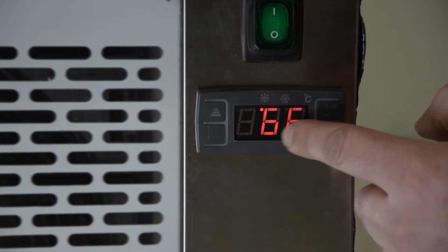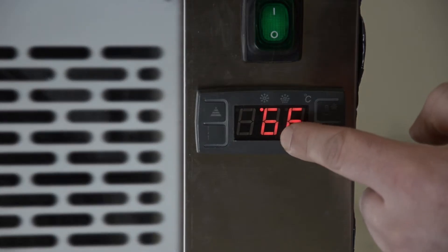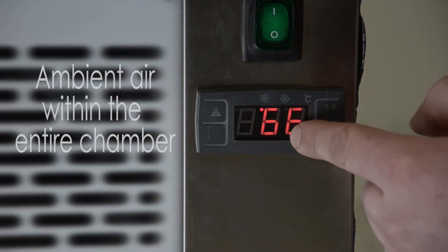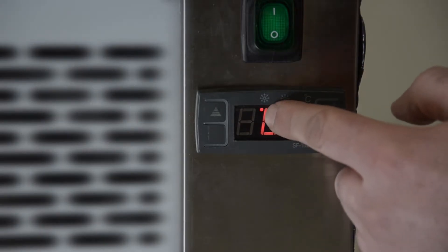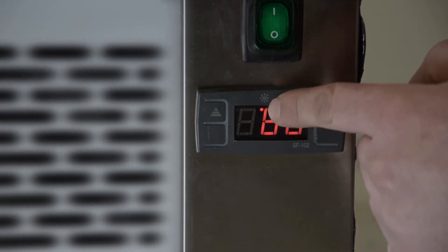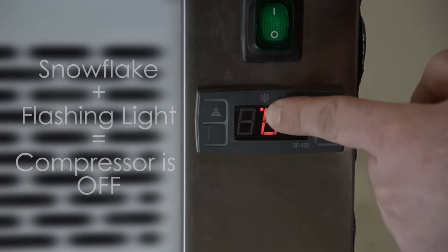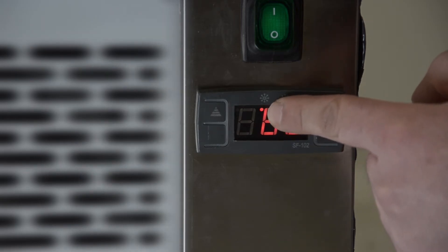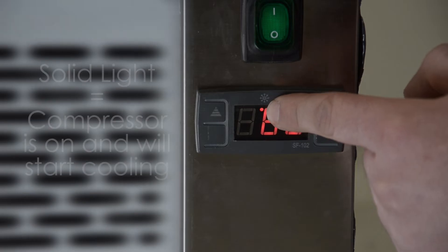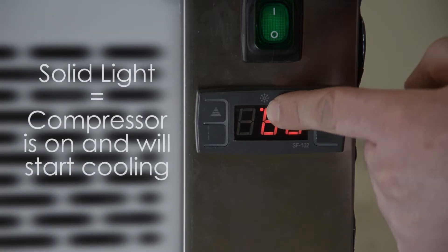This indicator is showing the ambient air temperature of the inside chamber right now. If you can see the little snowflake and that flashing, that flashing means that the compressor is not on, it's on a cycle. Once it's permanently red that means the compressor is on and it should start cooling.